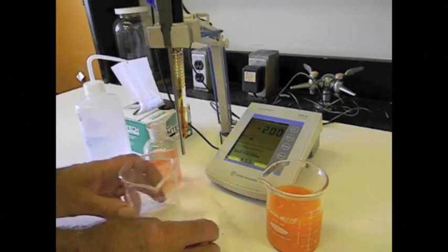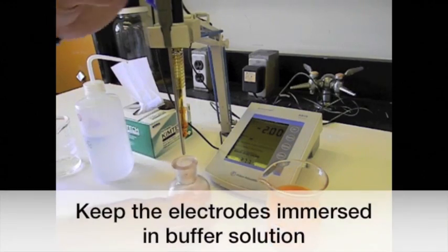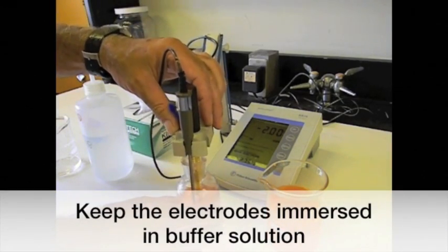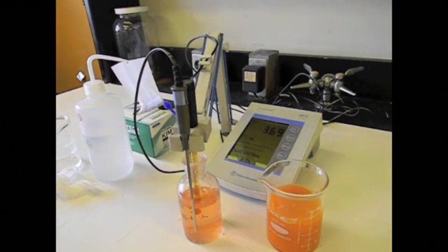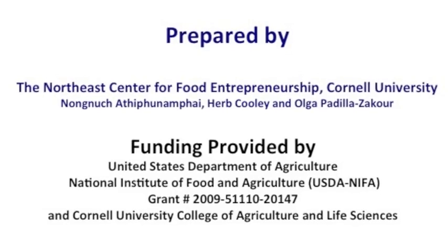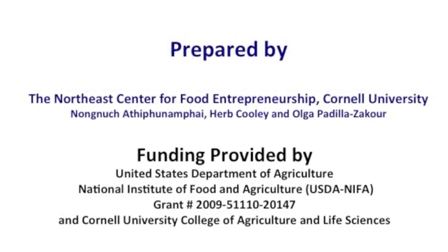When not in use, the electrode must be kept in buffer or storage solution. We acknowledge the funding provided by the USDA National Institute of Food and Agriculture and Cornell University.